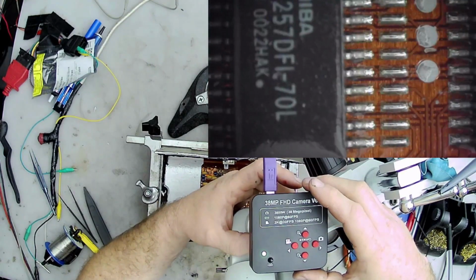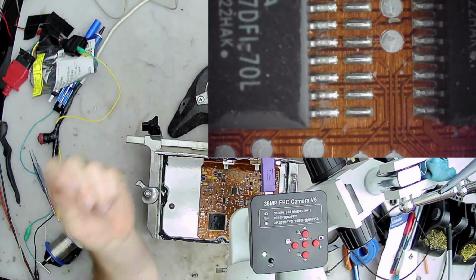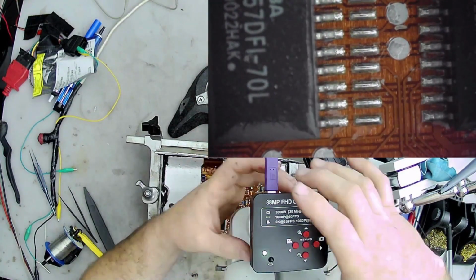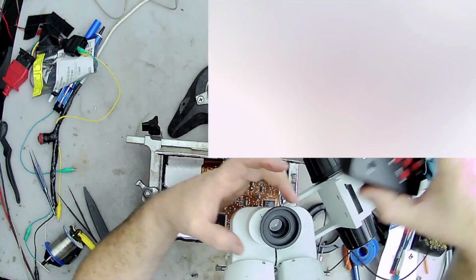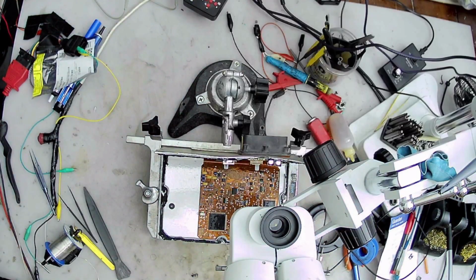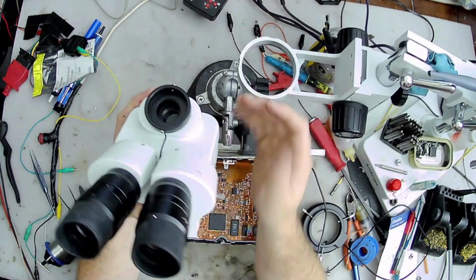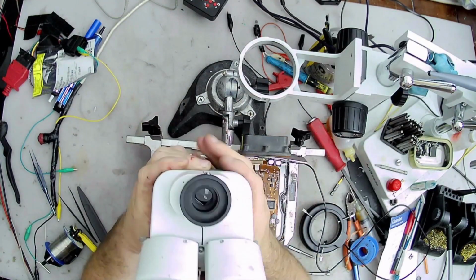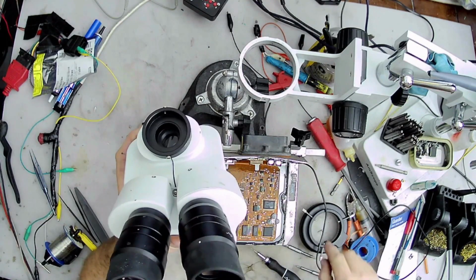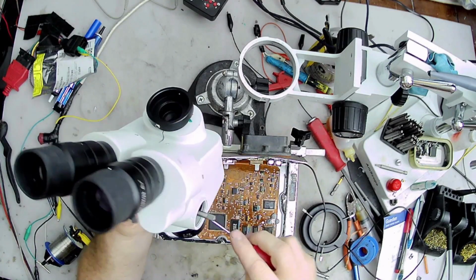And I think I double-checked with both of my lenses. I use a 0.5 lens a lot, and I use a 0.7 a lot. So I think I checked with each one of them, but I think I tighten it first. So here I took the camera off, and I'm being really gentle because right now it can spin. And I do have the marks up there, but still I want to try to keep it from spinning. So you still want to be careful with it.